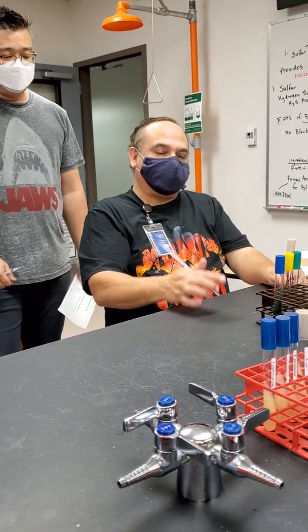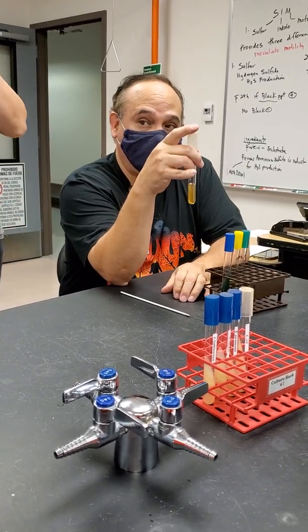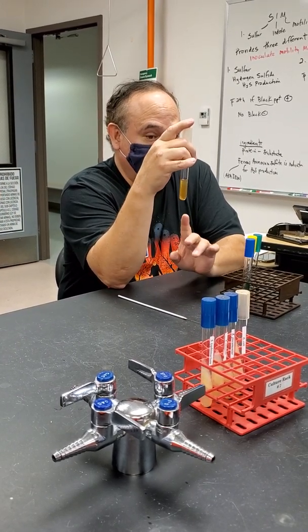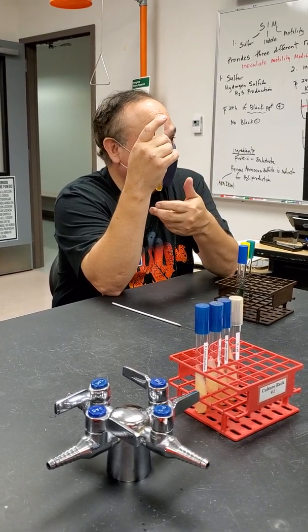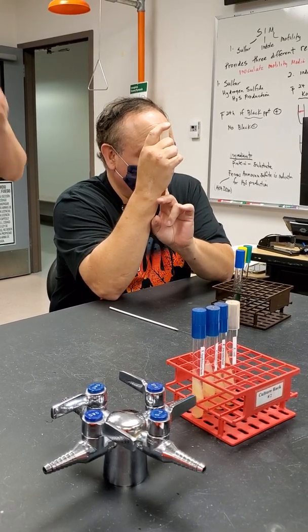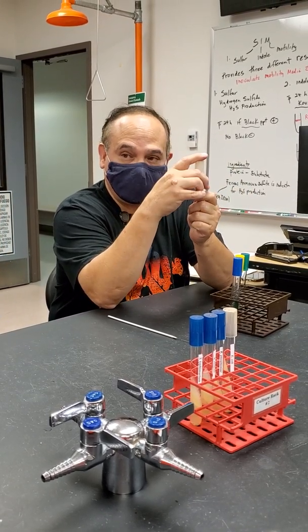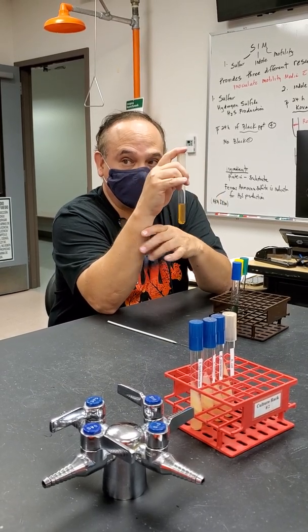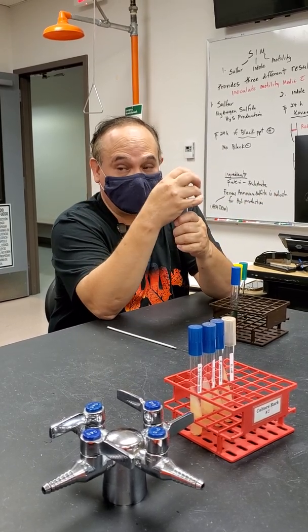Two of the results can be acquired just by looking at the tube when we come back on Thursday. Number 1, is there any black precipitate in it? If there's black precipitate, that means that the protein has been broken down by the microorganism. There is a little bit of ferrous ammonium sulfate in here, also known as iron. That iron will react with the hydrogen sulfide and produce a black precipitate. Black precipitate indicates that hydrogen sulfide has been produced by the microbe. So it's binary. Black positive, not black negative.